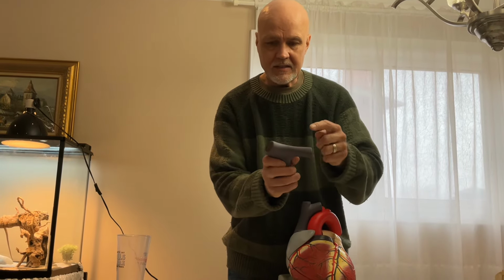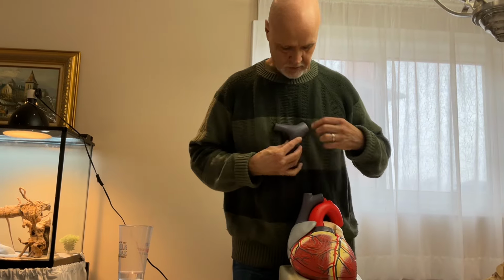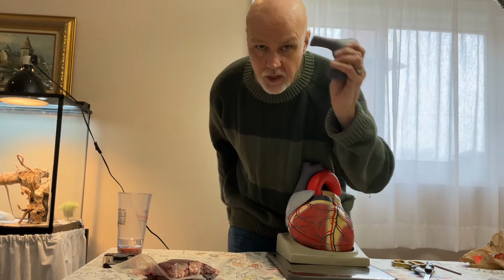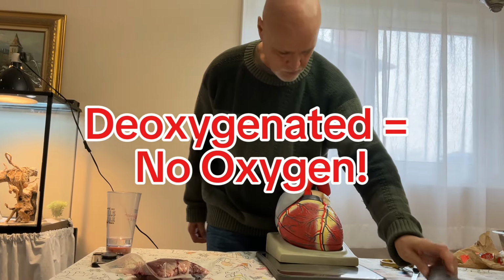And you see how it splits? So it comes out of the heart from here, and then it splits, so it can go to either lung. So there's your pulmonary artery, the only artery in the body with deoxygenated blood, in case you didn't know that.